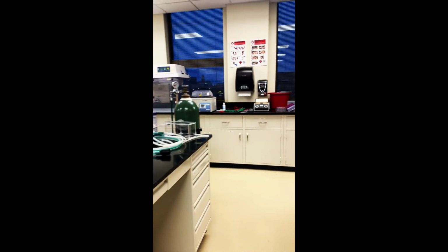So one thing that I do in research is I work with cells, and so when we have cells, we need solutions to work with them and to transfer them, and so we keep those solutions in either a fridge or a freezer. And so these solutions are super cold, and cells would get really hurt by that, so what we do is we put them in a little mini bath, as I'm showing you here.